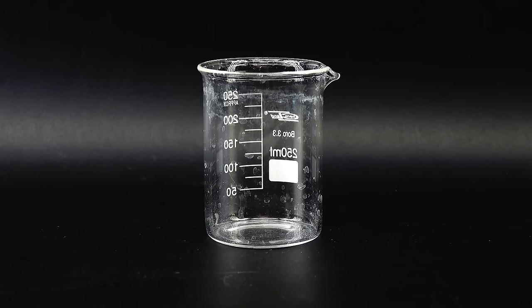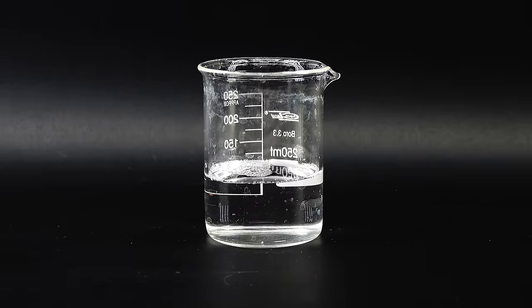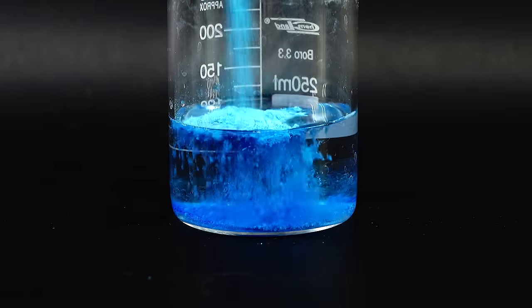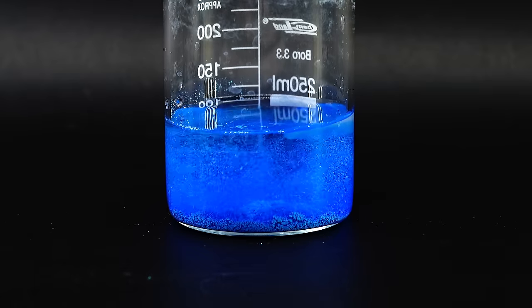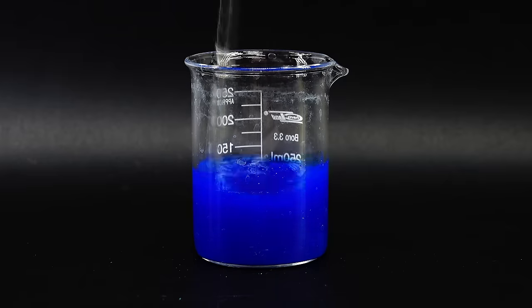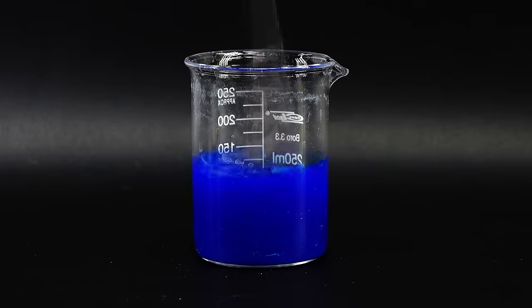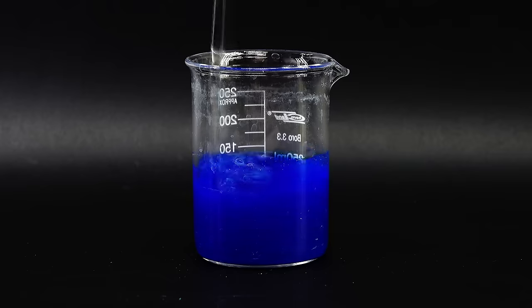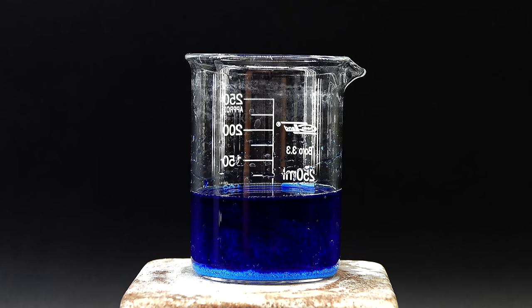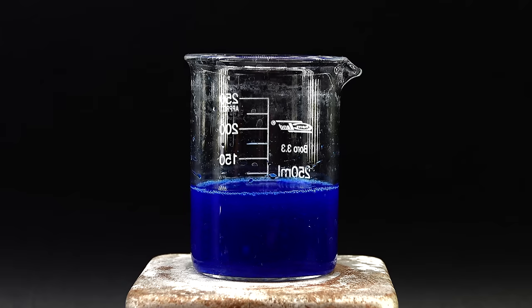Now with everything ready, I can finally dissolve some wood. To start, I have to make some pure Schweizer's reagent, and for that I got 100 milliliters of the 25% ammonia solution into a beaker, and then added 2 grams of my homemade copper hydroxide. It reacts with ammonium hydroxide to produce some Schweizer's reagent in a very pure form. This process unfortunately takes quite a while and can't be sped up by heating, since then most of the ammonia will just evaporate. This complex is only stable when there is a ton of ammonia present around it, which is why I used a gigantic excess. I got the beaker onto a hot plate with stirring to speed up everything a little, and when most of the copper hydroxide disappeared, it was now time to dissolve some wood.